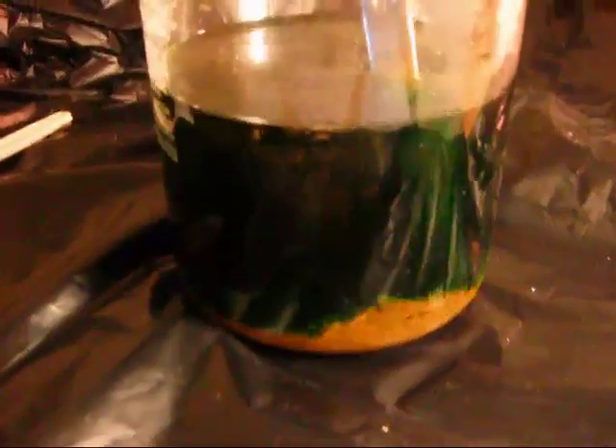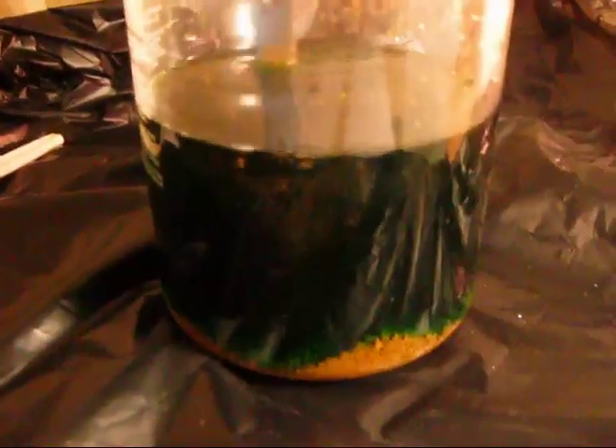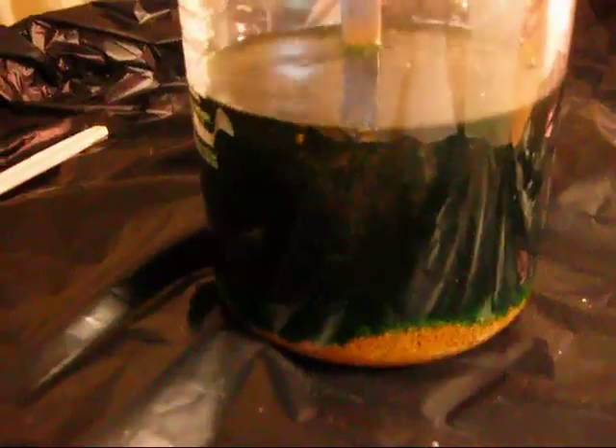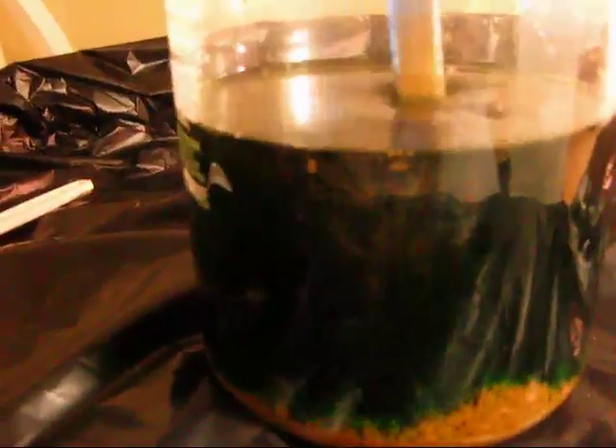And this is what I got. I got a little lucky because I'm not a chemist or anything, but this came out just the way I wanted it. They tell you it's supposed to be more of a sandy texture, but this came out to be a little bit more clumpy — you can see the clumps here. But guess what? It's still gold and it's still purified.